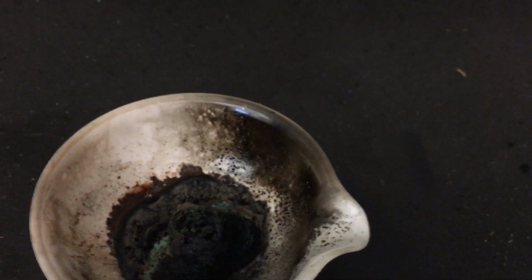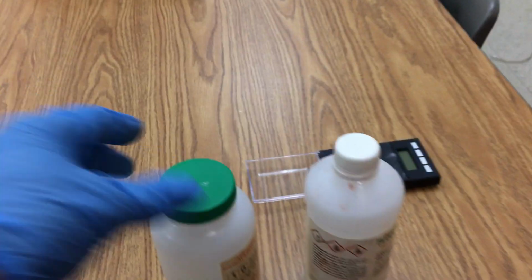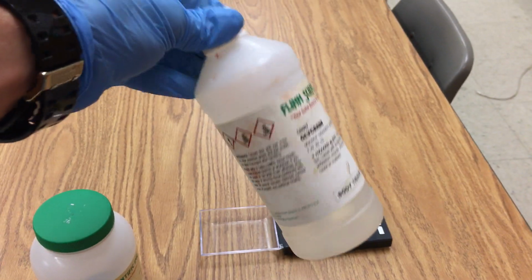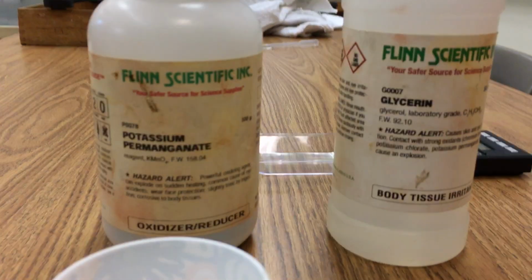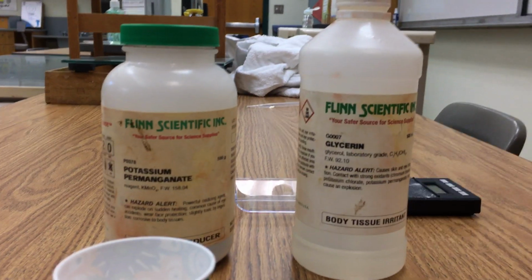It's very hot, and you can see some of the leftover products in there. Not going to touch that for a while. So, kind of a cool thing to think about. We have just a kind of black solid, and I just poured this liquid on top of it. And that was the reaction that occurred. It was the reaction of potassium permanganate with glycerol. Chemistry. For the win.